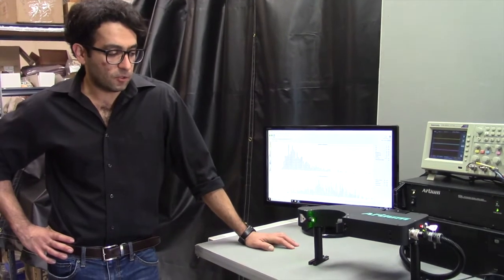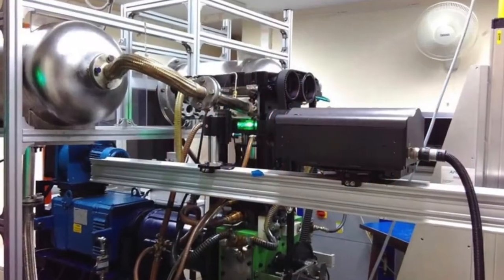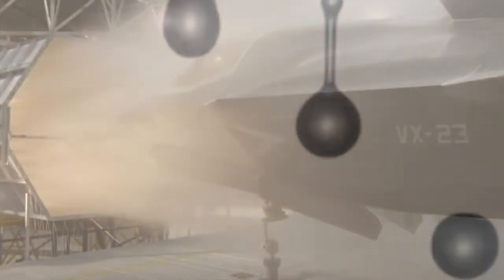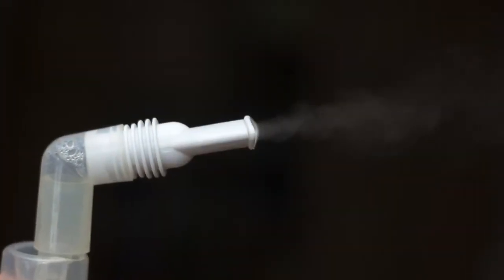PDI is a system that you use whenever you need to measure the diameter and velocity of round particles. It gives you a very accurate measurement. It is the state-of-the-art method in the market, and globally the most widely accepted method, utilized in many applications such as pharmaceutical, auto industry, manufacturing processes, inkjet printers, or anywhere that you have a spray or a stream of droplets that you need to accurately measure the size of.